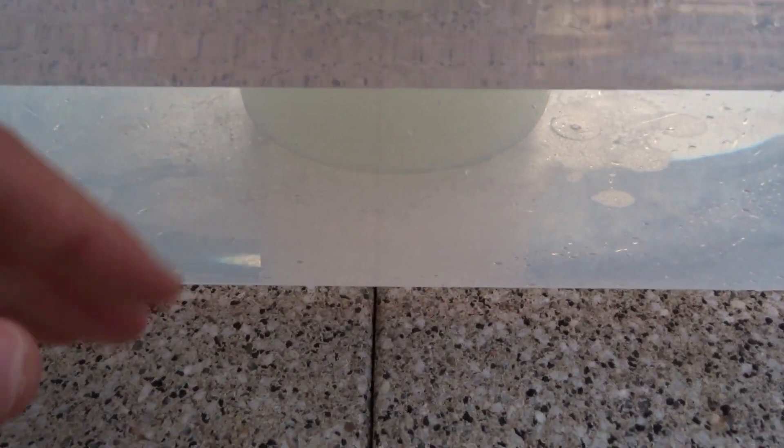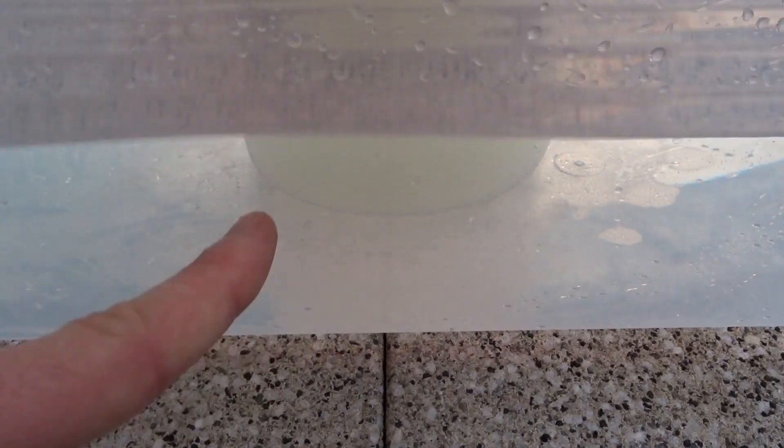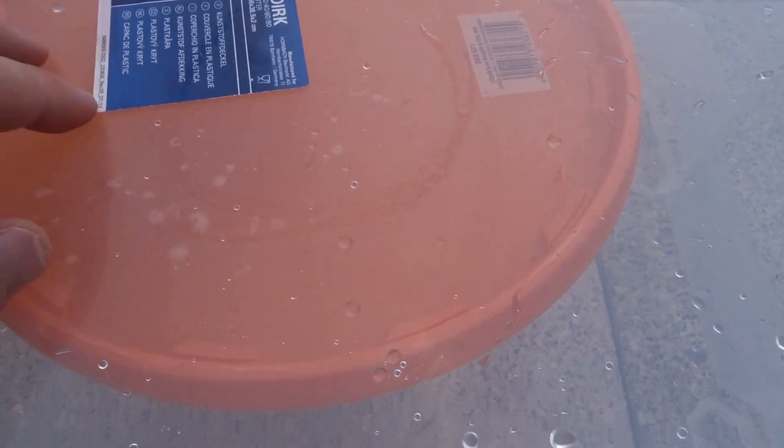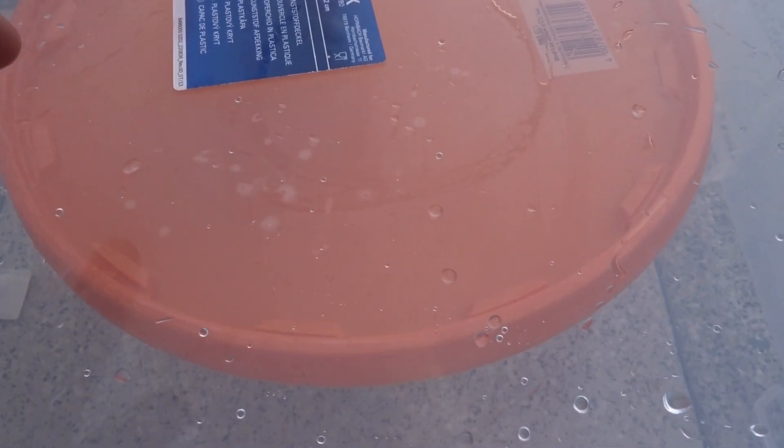As a little update, this is now as warm as a pleasant shower. But everything is good. This is cold. Just the beaker inside is warm, like 37°C. But I placed a pseudo condenser on top. This is a plastic lid with water filled in, so that stuff condenses and just drips down again. So I really don't care about it overheating.